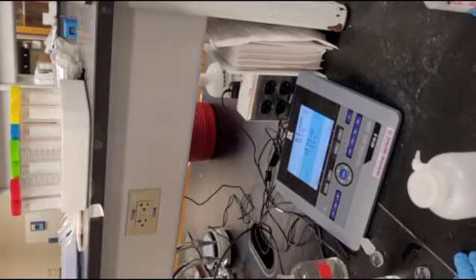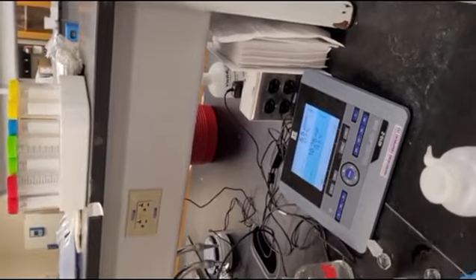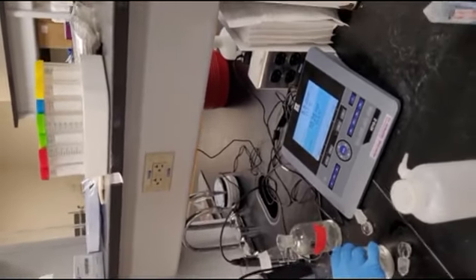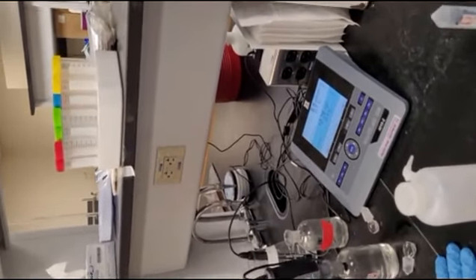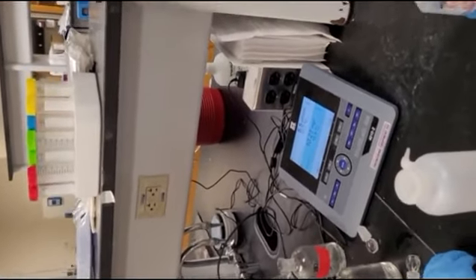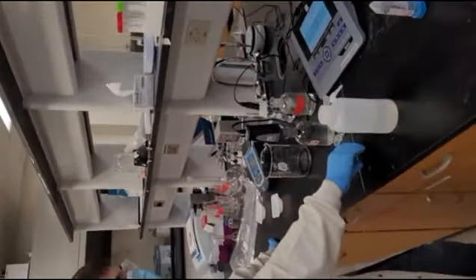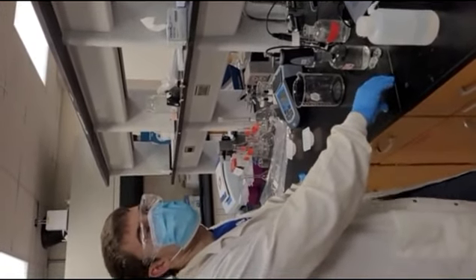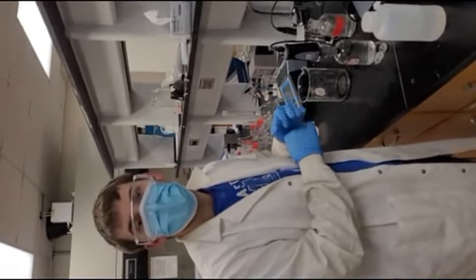The other thing to note is, when you take your readings a week later, there has to be a 2 milligram per liter drop for the test to be recorded, and it has to be above 1 milligram per liter. So if it doesn't meet those 2 criteria, then you discard the results for that particular test.